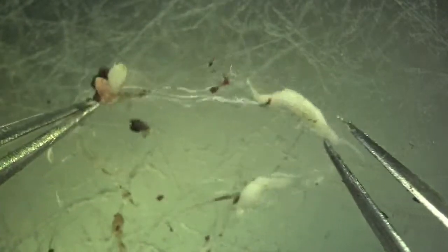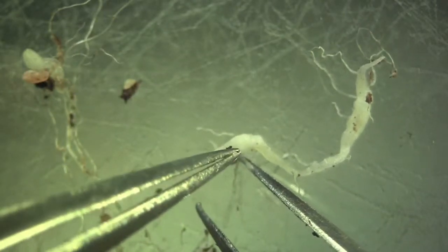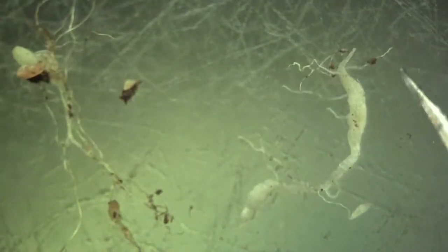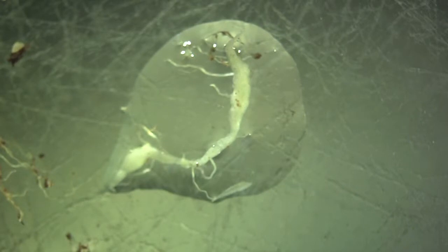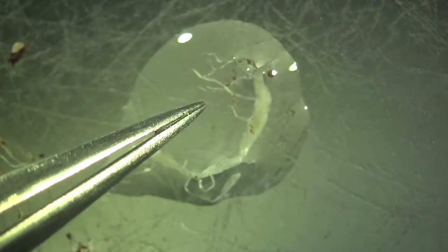We still need to clean up the sample. Whenever you're working with nematodes to get a rough idea of what you're looking at, the cleaner you can make the sample the better it will be for you later on as you're looking at the nematodes more closely. This root looks pretty good. Now all we have to do is add a little bit of water, put a drop on here, and then we'll start picking around in this root to carefully tease out any female nematodes. In the case of root knot, they're a little bit easier to work with than most other nematodes.